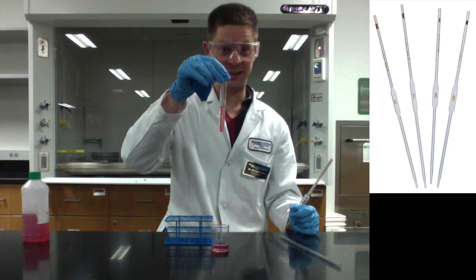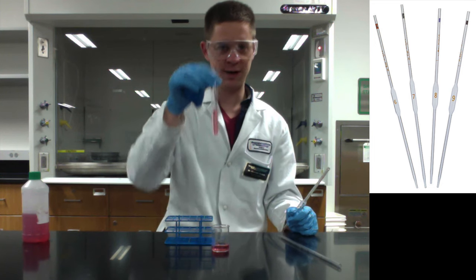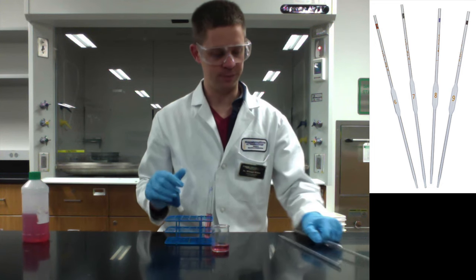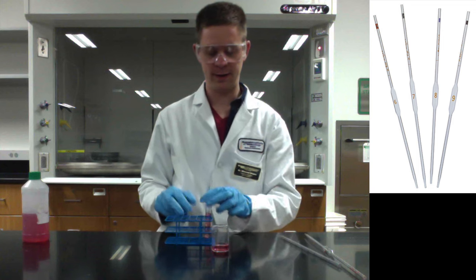They're meant to hold on to that last little bit of liquid. And this, what we have in the test tube is now pretty damn close to 10 milliliters. So that's the volumetric pipette in a nutshell.